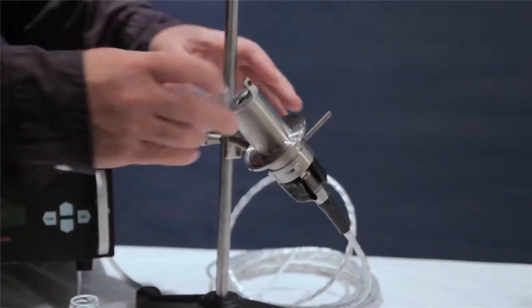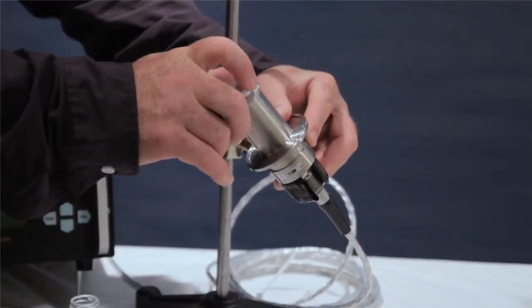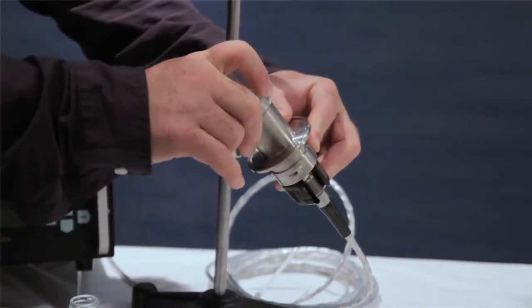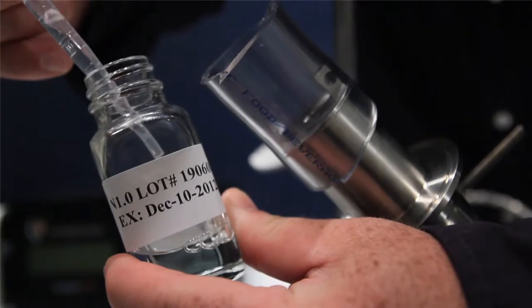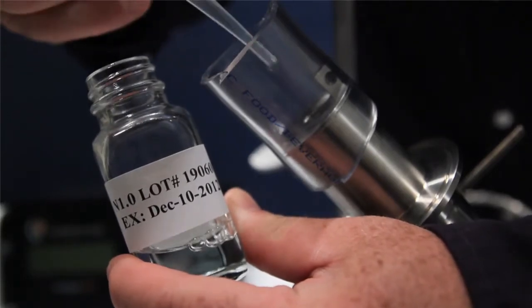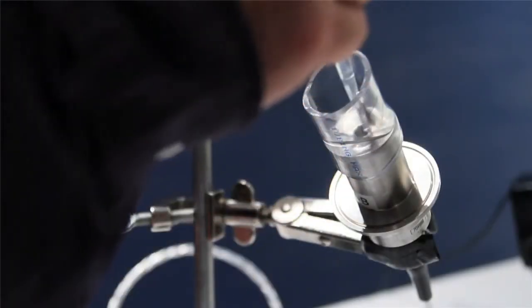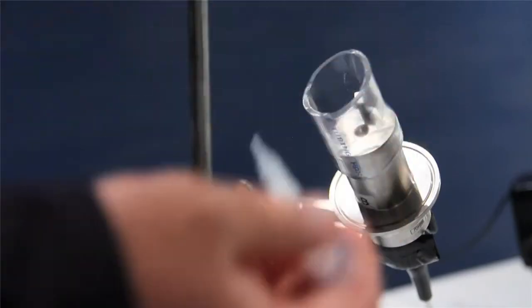Step 2. Place the 1.25 inch tubing over the end of the sensor to create a fluid reservoir. Mount the sensor at 45 degrees upward from the horizontal and add the test fluid until it covers the mouth of the measurement chamber completely. It's recommended you discard the first sample of calibration fluid and introduce fresh sample to prevent possible cross-contamination.